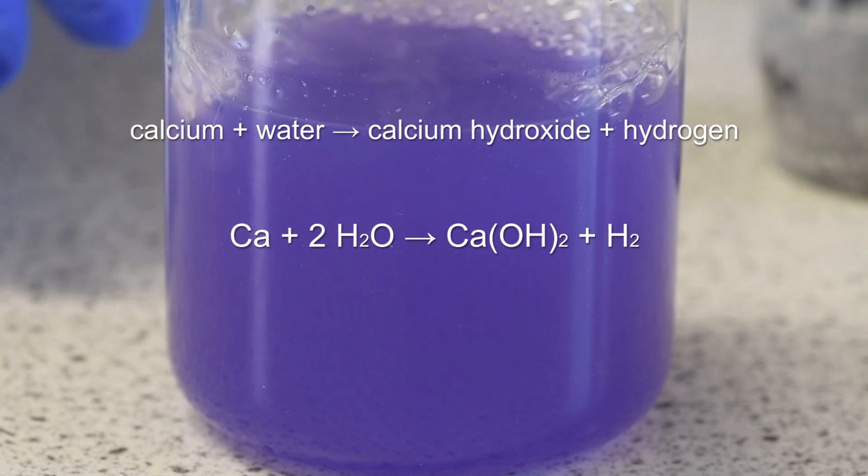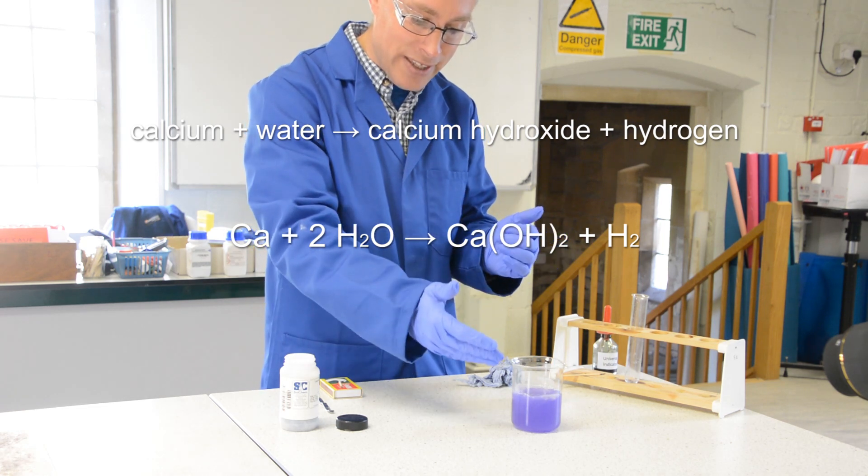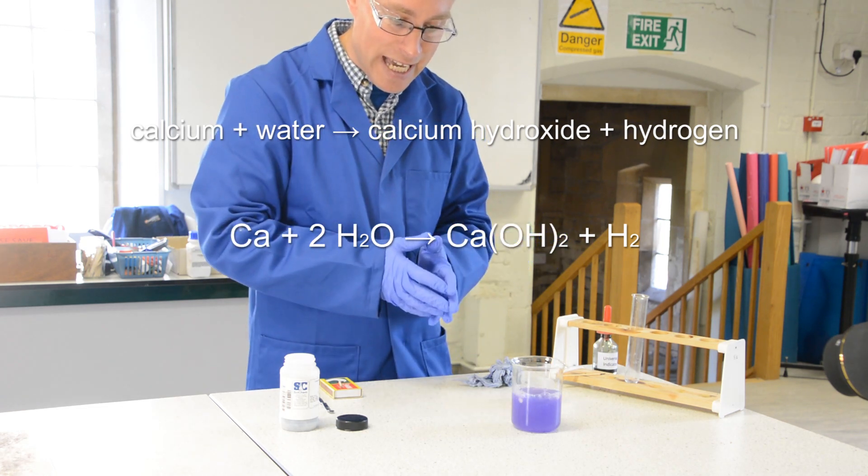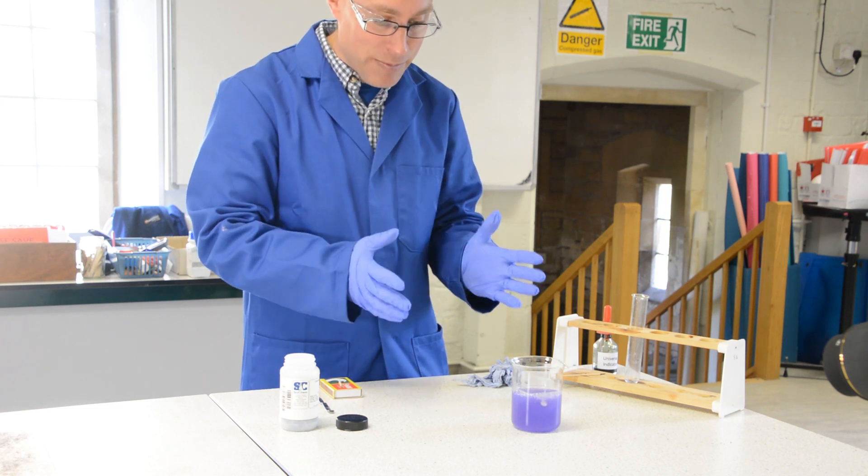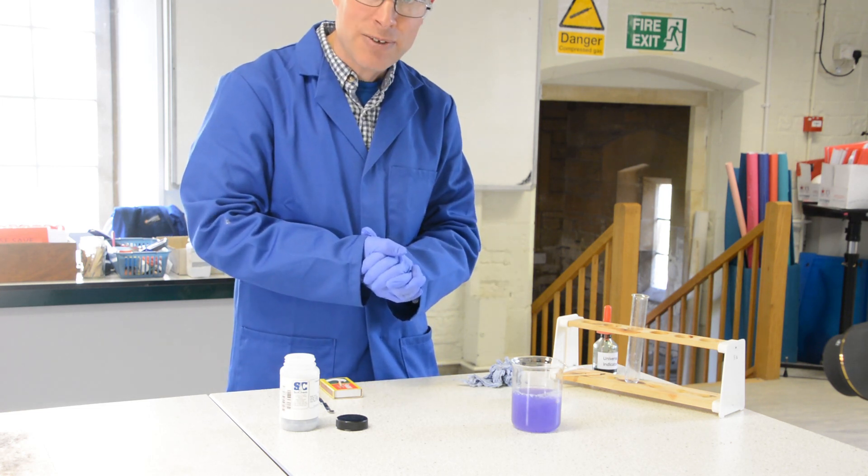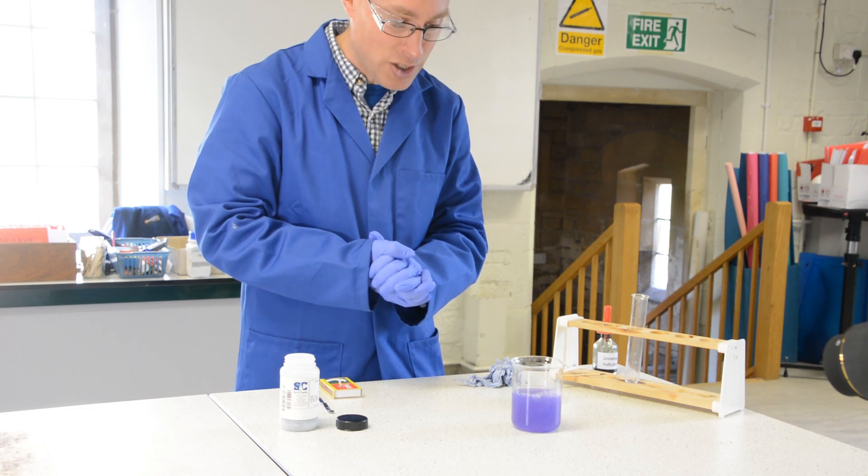And that calcium, as it gets to the surface, the hydrogen escapes and the calcium will sink again down to the bottom. So compared to the magnesium, the calcium reacts much more vigorously.